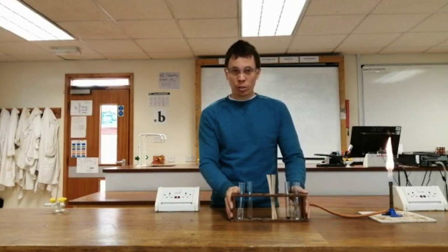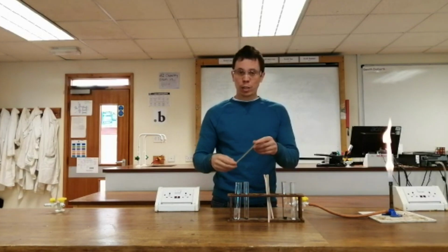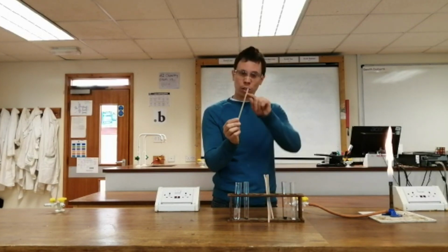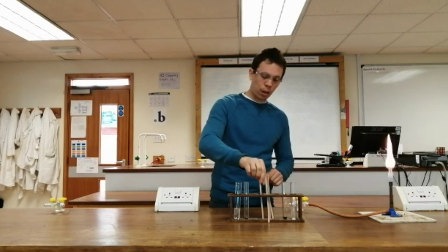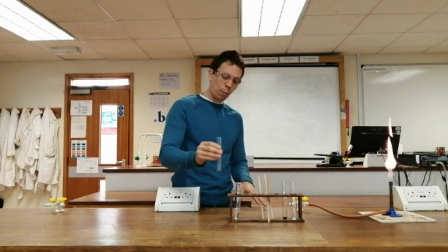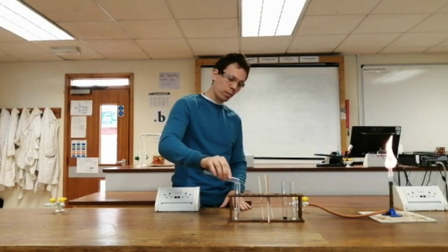Now, to test for oxygen gas, you don't need any special chemicals. You simply need a splint that you've put on fire and then blown out so that it's still hot and it's glowing. So to start off with, I will make my oxygen gas by putting my catalyst in. So this is a decomposition of H2O2, breaks down into water and oxygen.